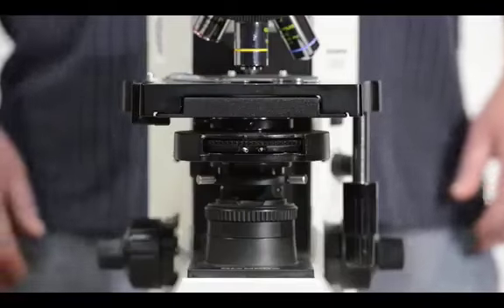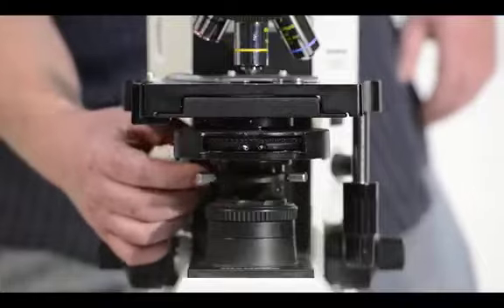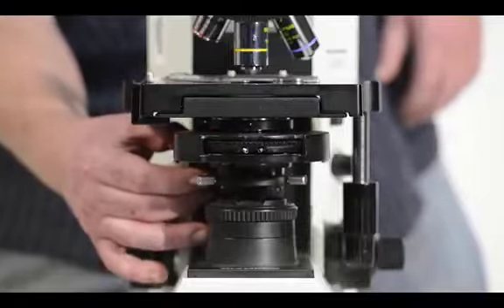Compound microscopes produce a very flat image. To improve on this and add contrast, you can move the condenser lower and adjust the intensity of light. It is easy to get lost when looking at fast-moving organisms, so be sure to use Protoslo, and when you do get lost, just refocus on the edge of the cover slip.